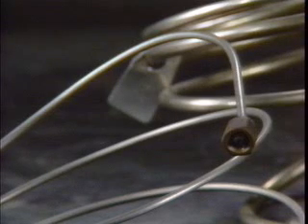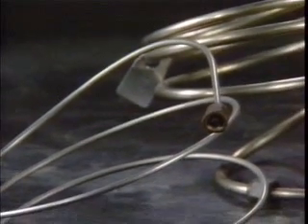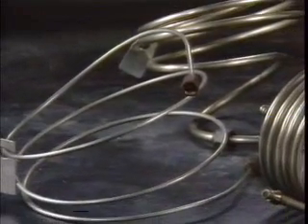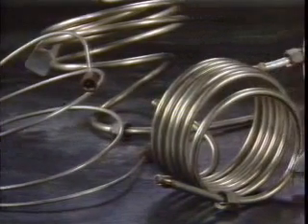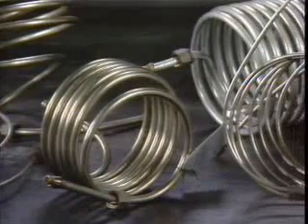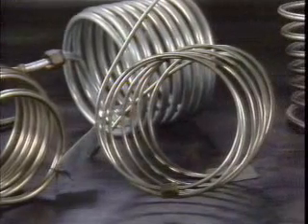The length chosen for the chromatographic column is dependent on the difficulty of separating the components. Columns may be as short as 10 centimeters or as long as several meters. The diameter of the column is usually chosen after a consideration of the amount of sample to be separated. Large diameters are used for large samples. Diameters ranging from a few tenths of a millimeter to several millimeters are common.